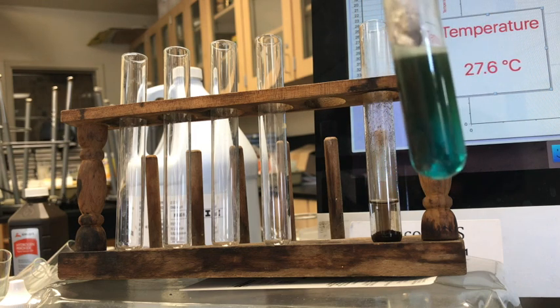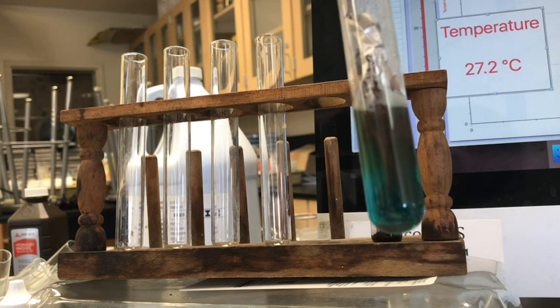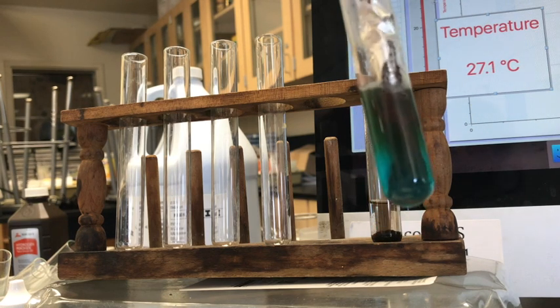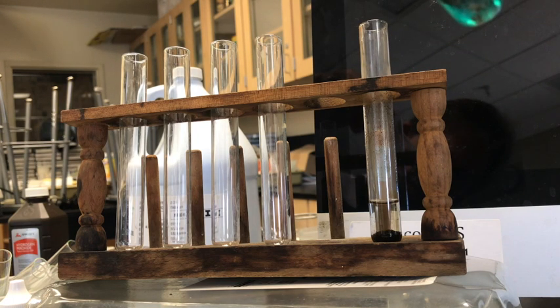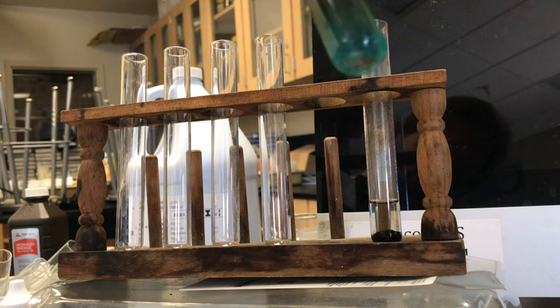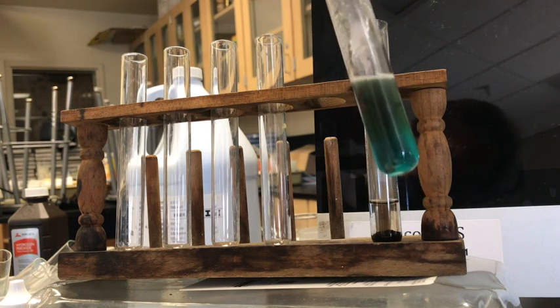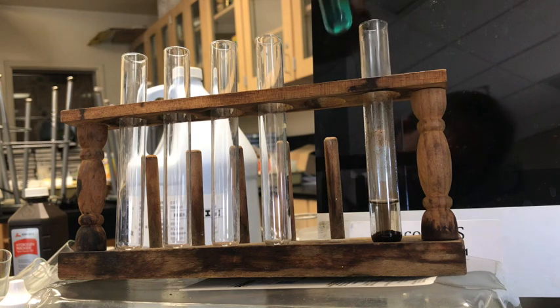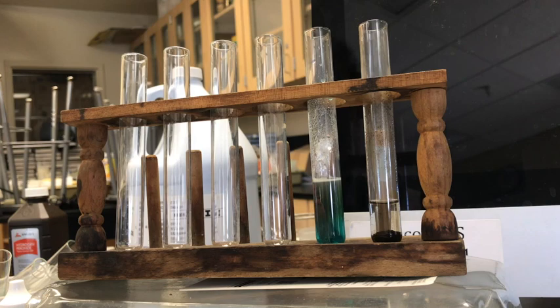And if there's just a little more light, you'd see it's a little reddish. Right there, maybe you can see it's a little reddish. New bubbles. Yep, it looks like new bubbles forming. And we're going to come back to this later, but let's see if that helped the temperature. Remember, it was 36.5.